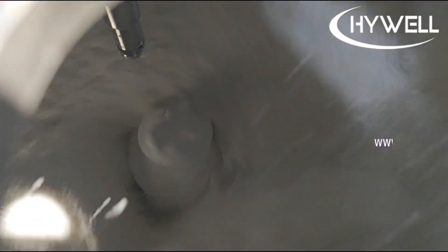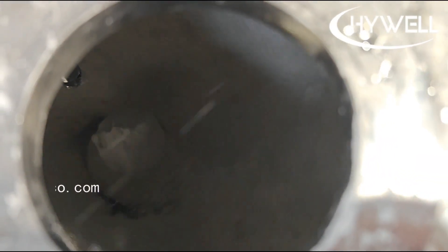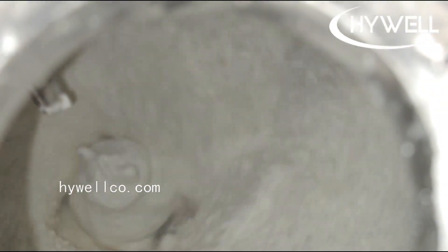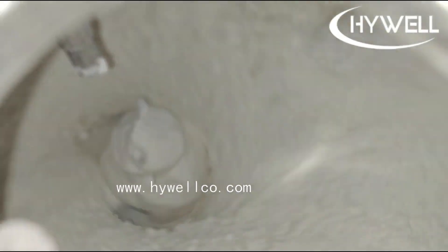The wet instant granulation line production process includes the following steps. First, a vacuum feeder transports the powder material to the high shear granulator. Second, liquid is sprayed in proportion to the weight of the material, and the water content is usually increased by 13% of the total weight. In the high speed mixer, after 3 to 5 minutes of high speed mixing, the material is discharged to the swing granulator.